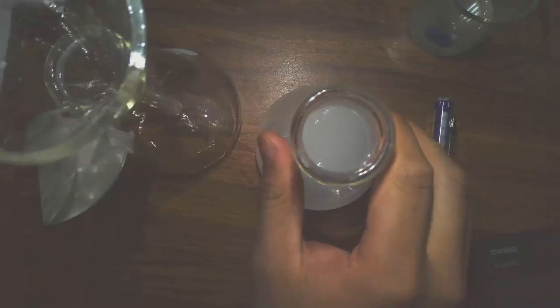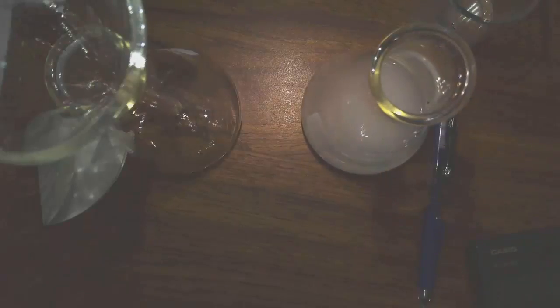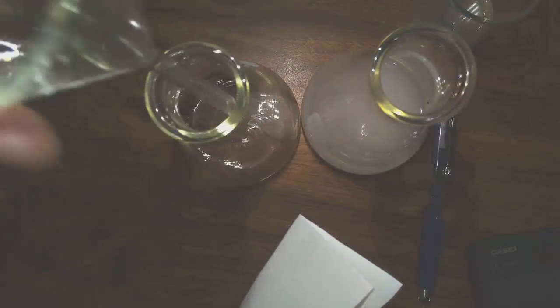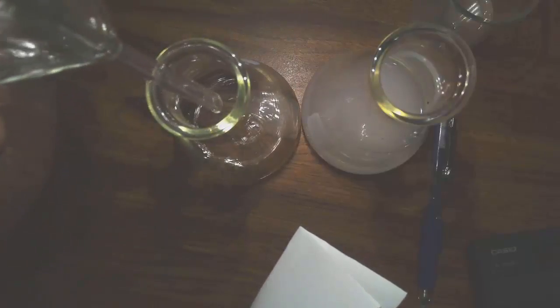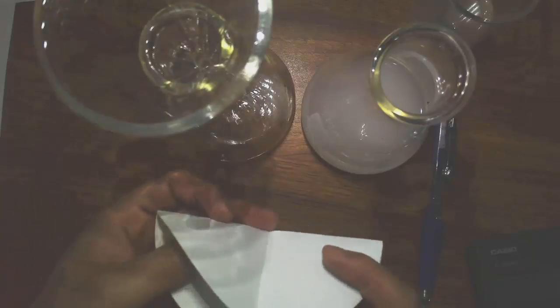So if you notice, look at this precipitate. Now it's on the bottom, right? So to prove to you that the precipitate actually formed on the bottom, we're going to filter it out. So here I have a funnel with the flask. And the flask is best used with the funnels to filter something. And of course I have the filter paper right here.